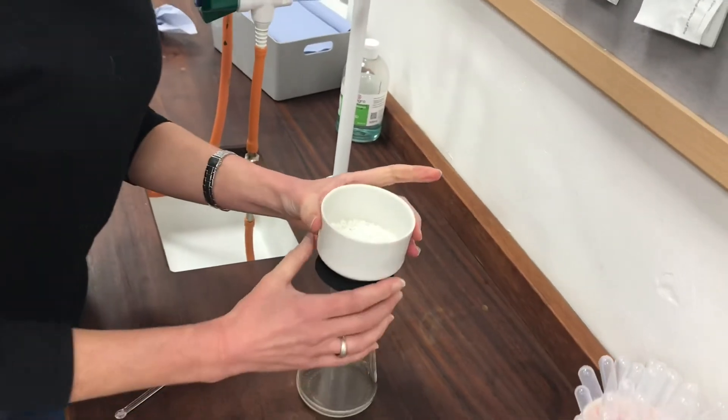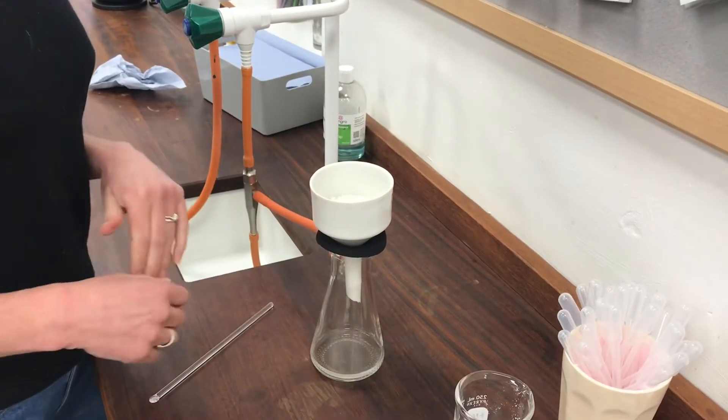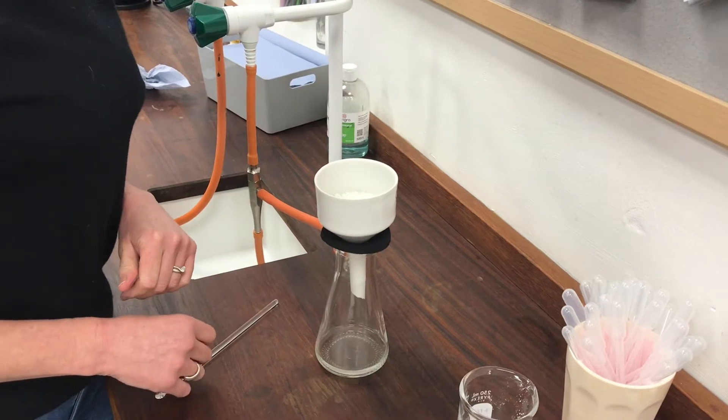So the first job is to transfer this product into a nice clean beaker. And then I'm going to recrystallize it from the minimum amount of hot ethanol.